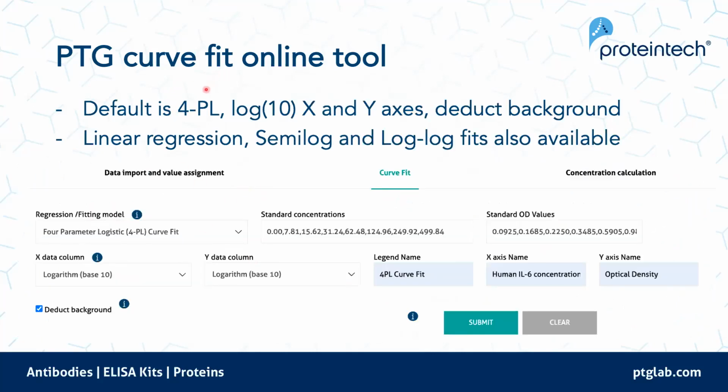Also, along with our curve fitting tool, because we know that the 4-parameter logistic, the 4PL, is the best curve fit, the default setting is 4PL, and also logging the X data and the Y data, so the OD and the concentration. And we've also made it automatically deduct the background. These can all be played with. You can change your regression fitting model to something like a linear regression or a semi-log fit. And you also have the flexibility of naming it yourself.